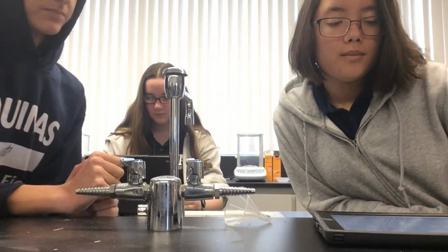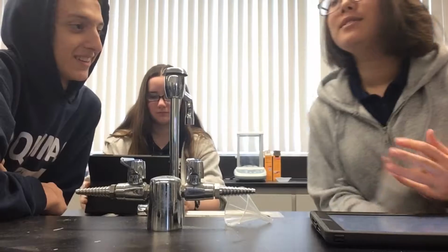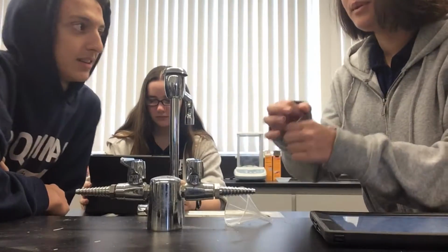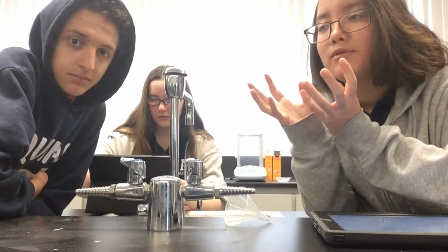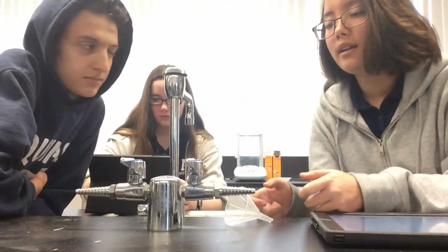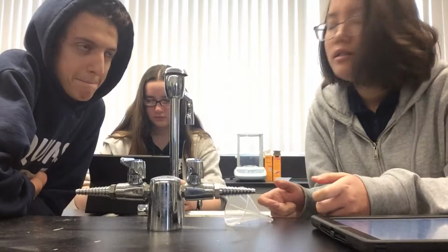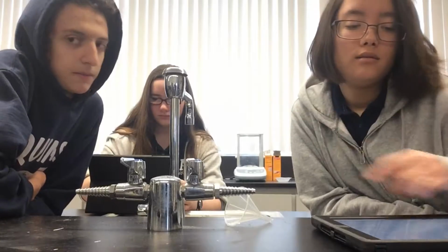Okay, so the reaction was an endothermic reaction, meaning that it's heat absorbing, and it bubbled up and went into this balloon. The carbon dioxide that formed went into the balloon, and the salt water stayed underneath. Also, the temperature got colder.